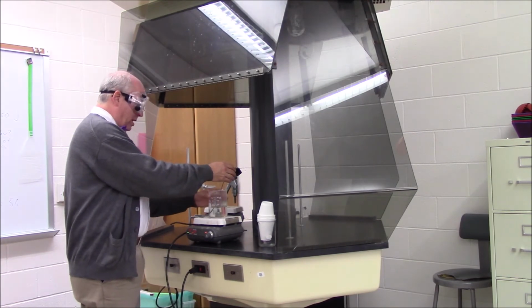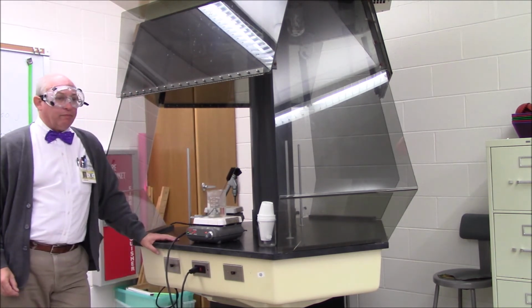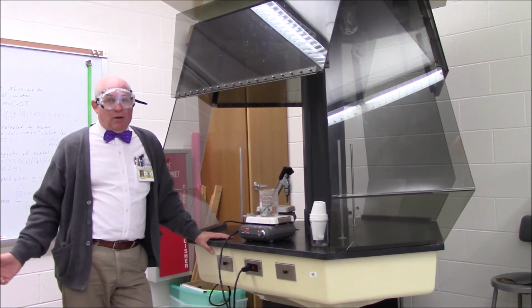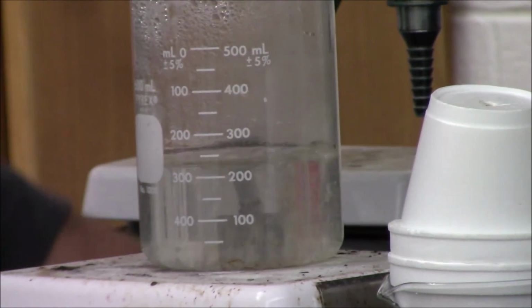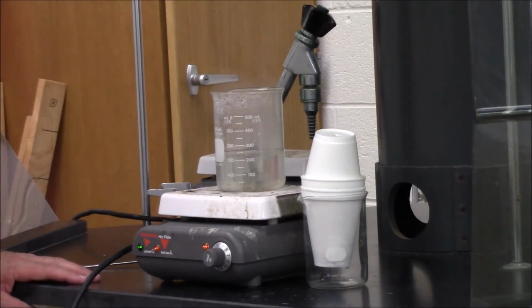This is going to be heated up close to 100 degrees, boiling water. Then we'll do the same transfer we did last time, and then you'll do the calculations. So our water is 99.6 degrees, which is also the temperature of the metal.